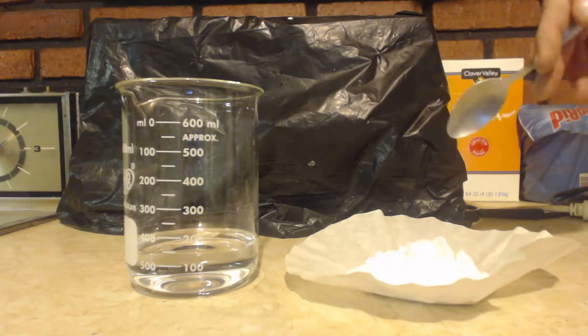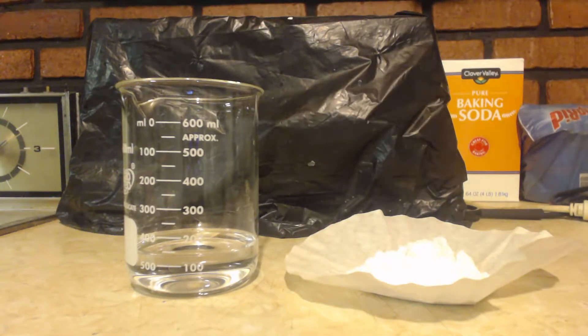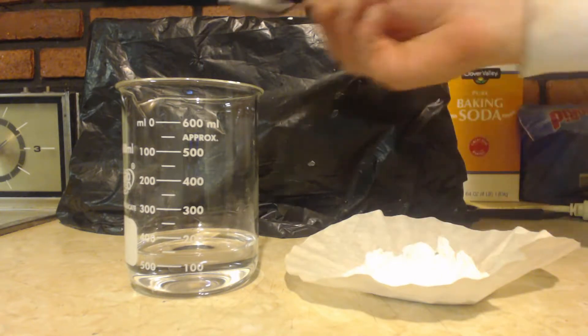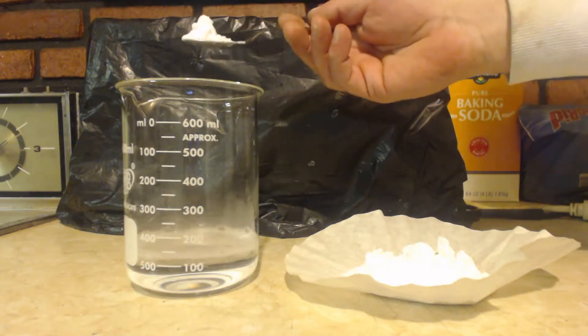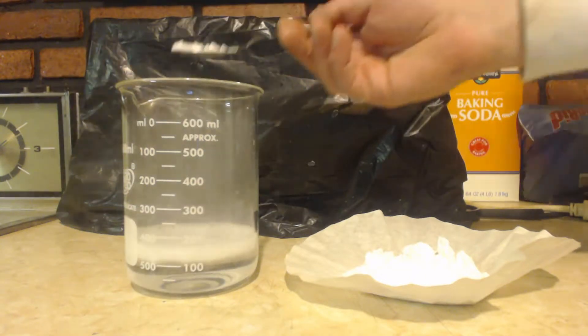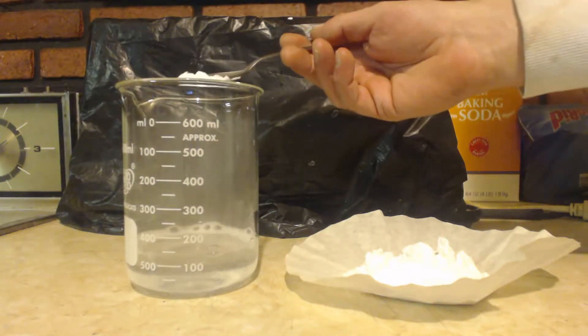I've got 78 grams of calcium carbonate and 156 milliliters of concentrated HCl. I'm just going to put it in there. You can see it fizzes vigorously, so it's going to take me a while to do this.